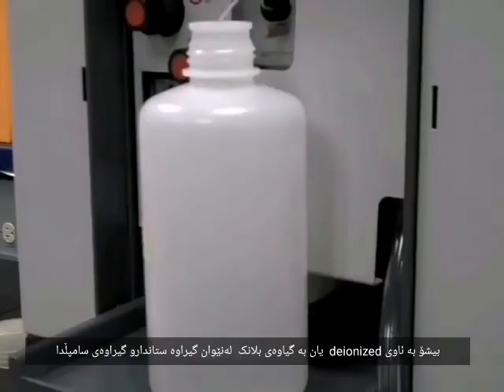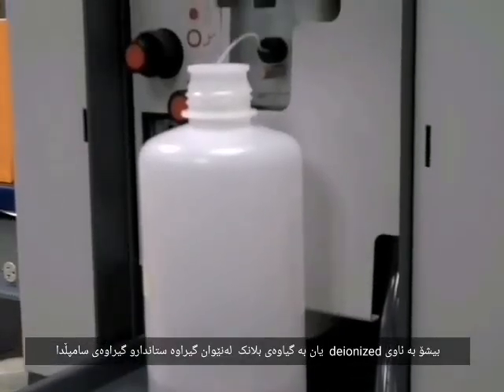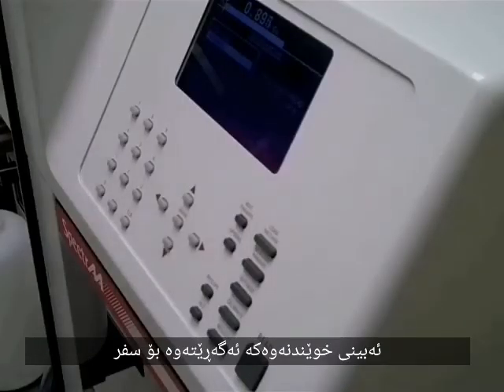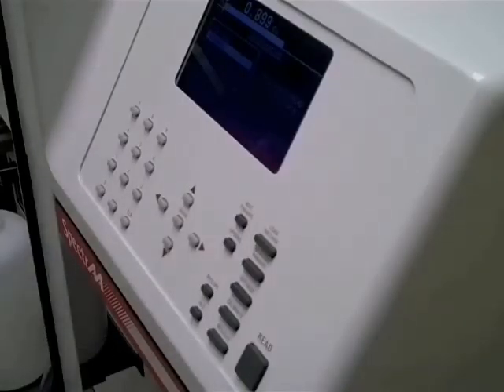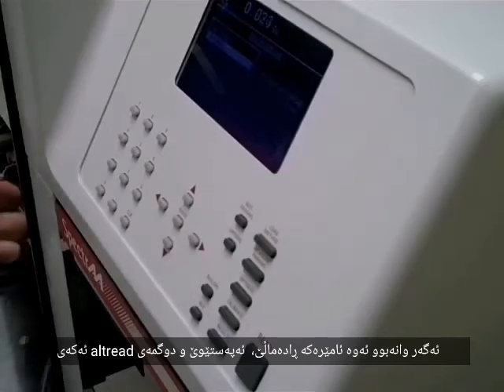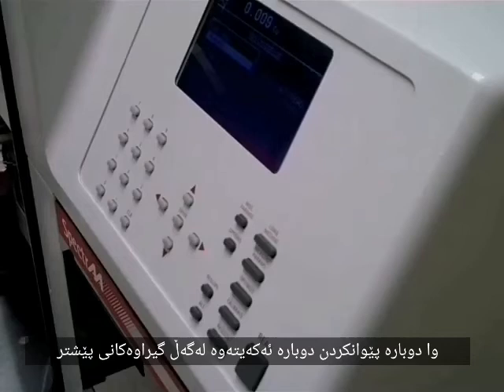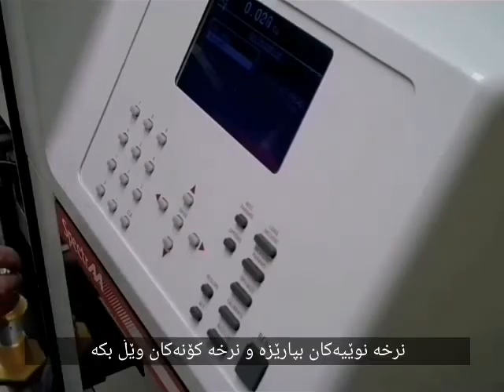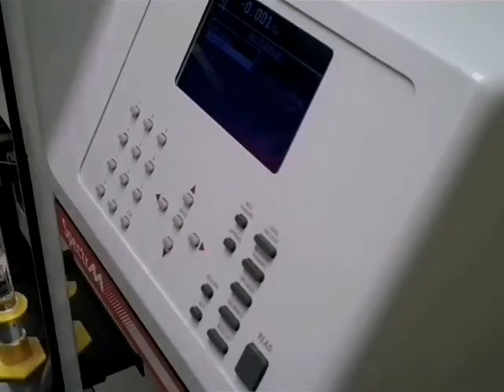Rinse with deionized water or the blank solution in between the standard or sample solutions. See that the reading returns to 0. If it does not, the instrument has drifted. Press the Alt and Read buttons simultaneously and repeat the measurement on the previous solution. Keep the new value and throw away the previous reading.